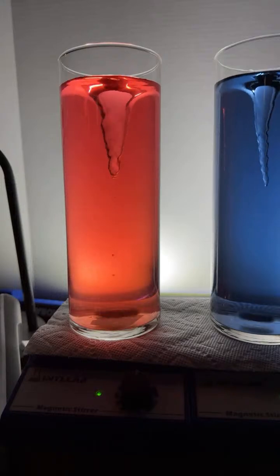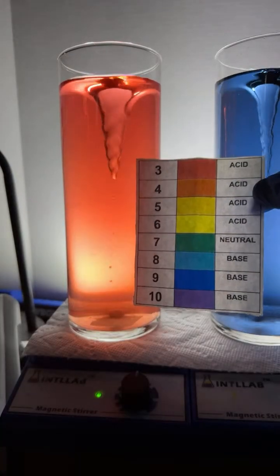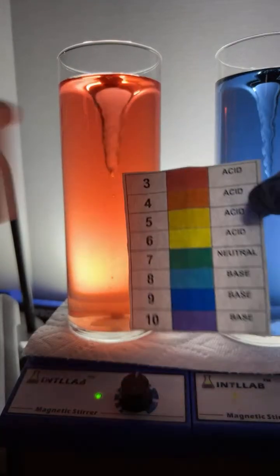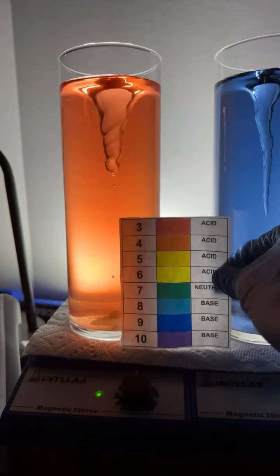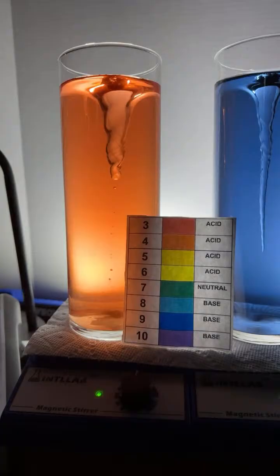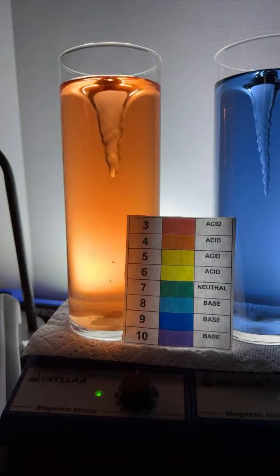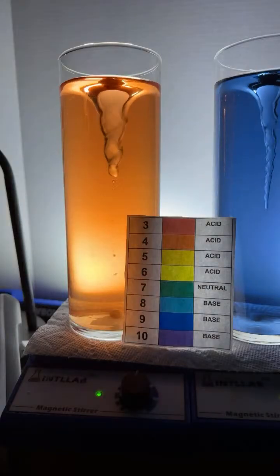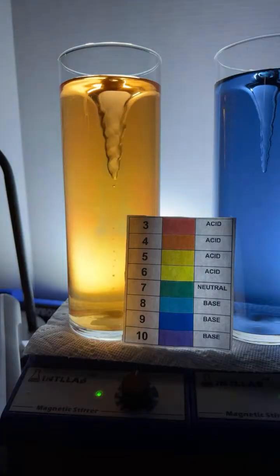The pHs are here. So right now we're at about pH 4. You see how there's an orange color? You can see the different colors there on the pH scale. What did I do? 2 drops? I can't remember. Am I on 1 or 2 drops? I think I'm on 2. So we're going drop number 3 now, unless you all correct me. In goes drop number 3.